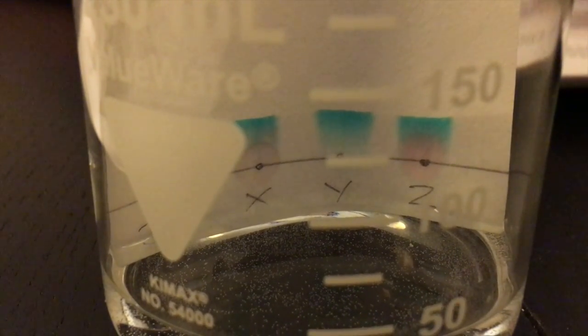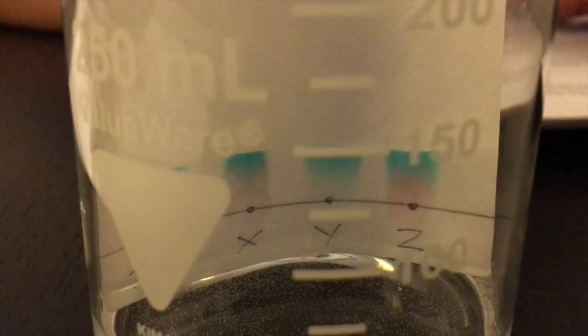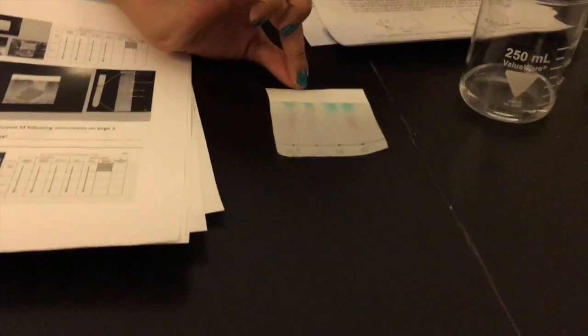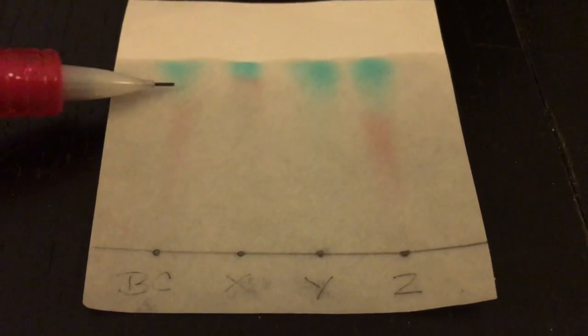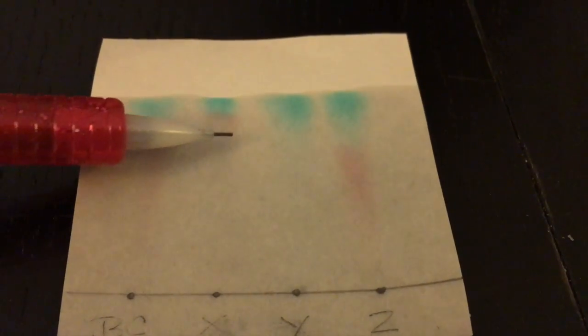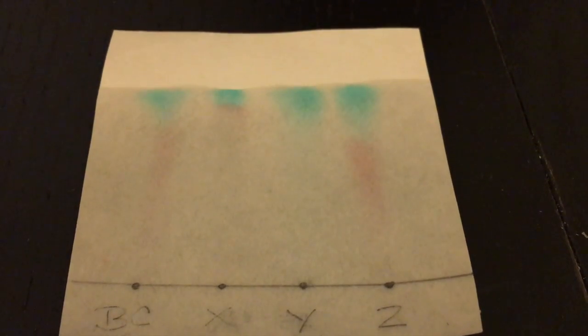This will happen fairly quickly — within five minutes, the pigments should rise and give a very clear indication of all the colors in each plant species. You can see it rising now. Once the pigments are clearly visible, pull the paper out of the water, lay it out, and compare them. BC shows a little bit of orange before it divides into a blue color; X shows a little bit of green or blackish-green before it divides into a blue color, and so on.